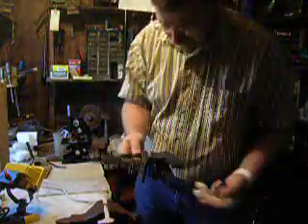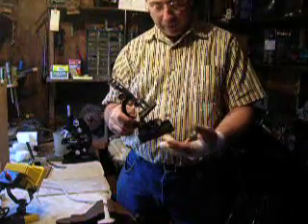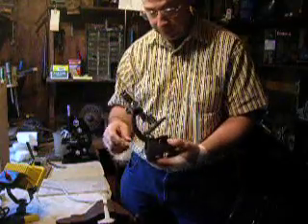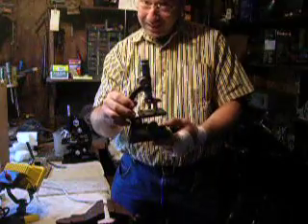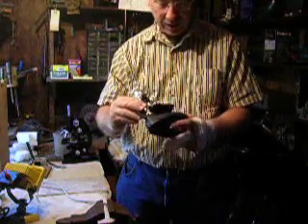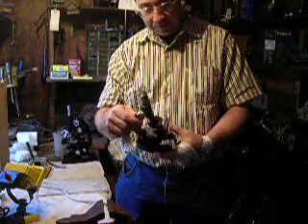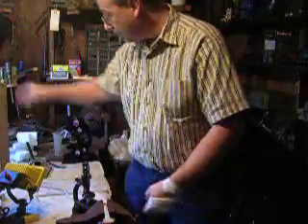Yeah, hi. I just wanted to make everyone aware of how I was doing my microscope work. It's something that I would hope everybody else would be able to do. With the cheapo microscopes that you can get for like $8, you just get one of those. I got this at a flea market. The lenses aren't too bad, but the main thing is you just do a little setup.